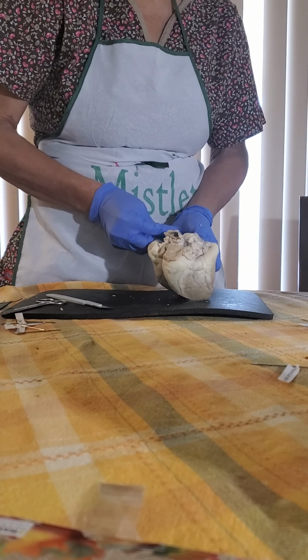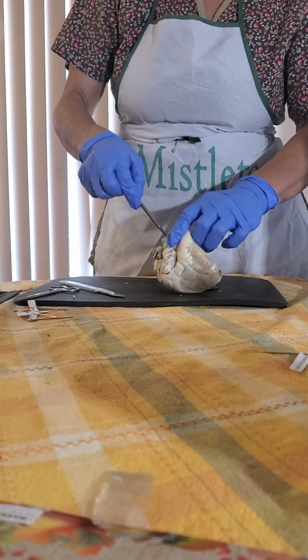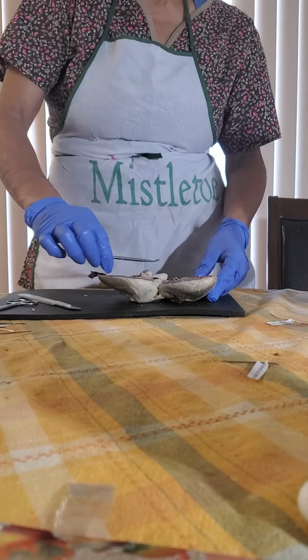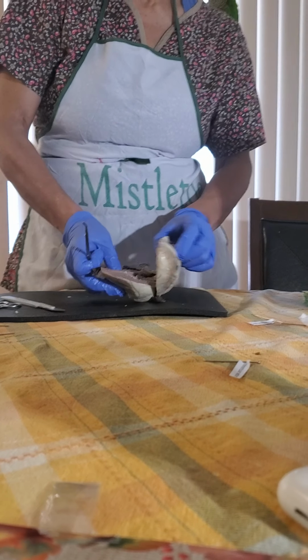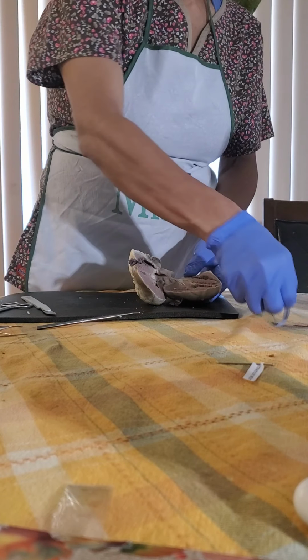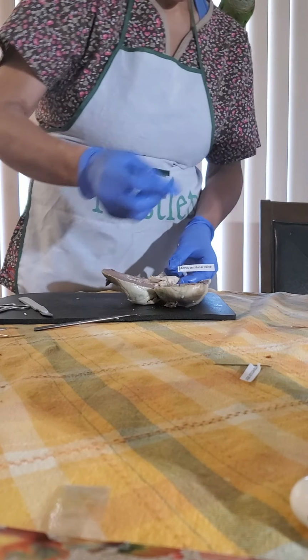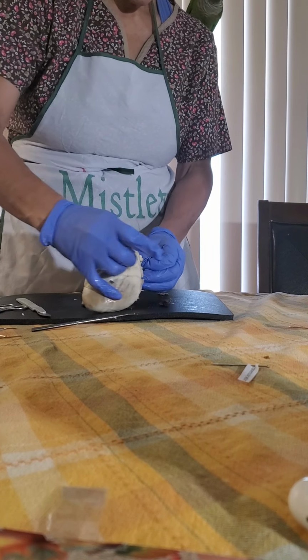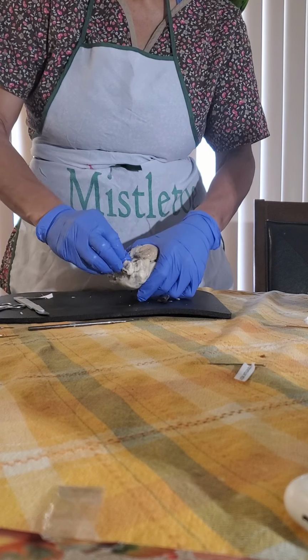And it will return back to the right atrium, to the vena cava, through the tricuspid, enter the right ventricle, to the pulmonary artery. And the cycle goes again. So as you see, we have here the aortic semilunar valve. We have the aorta, which is the thickest and biggest of our vessels, and you can see that it is one of our biggest openings right here.